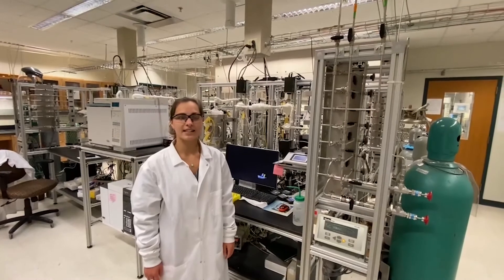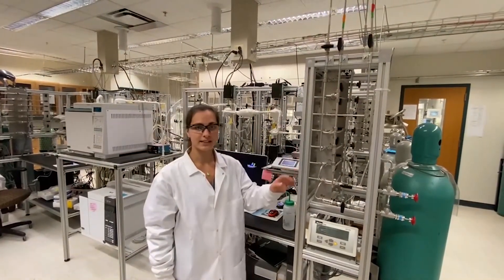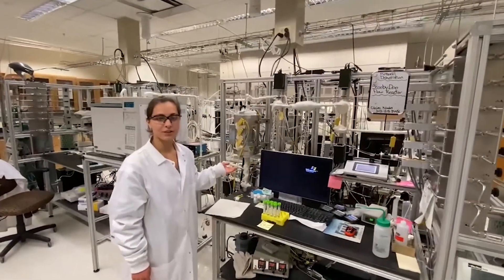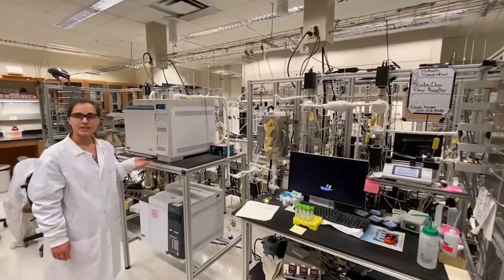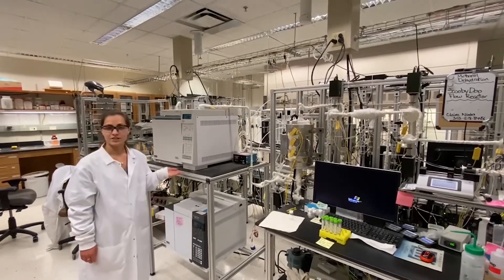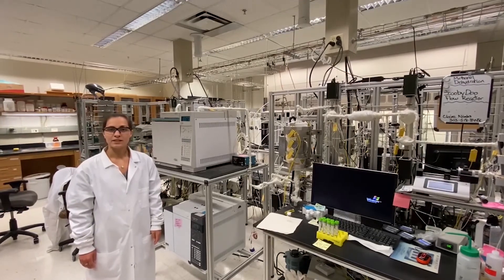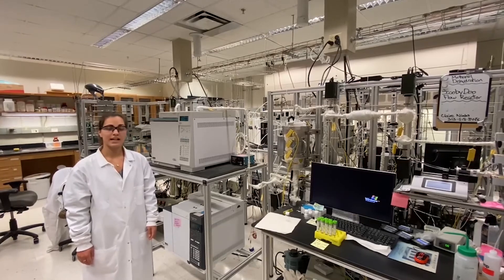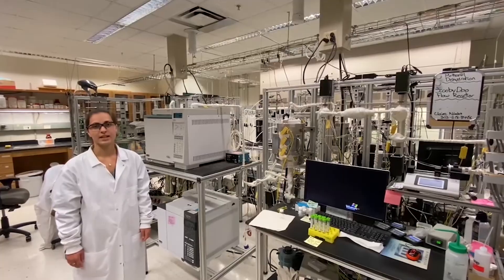Each reactor has a custom flow unit that was built to control the gases, as well as a three-zone furnace where the catalyst in a reactor tube is housed, and finally some type of quantification equipment to analyze the products — in this case, a GC. We also have some GC-MSs, and some of these units are automated with LabVIEW to control the gas flows on the custom manifold, as well as the software for GC-MSs.